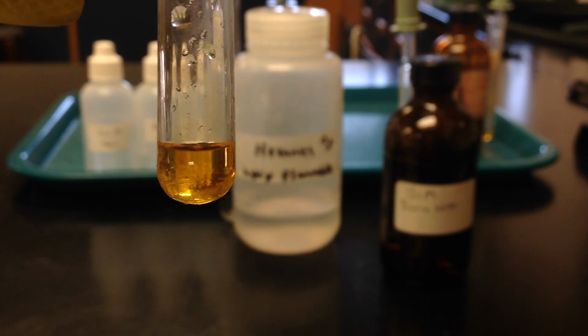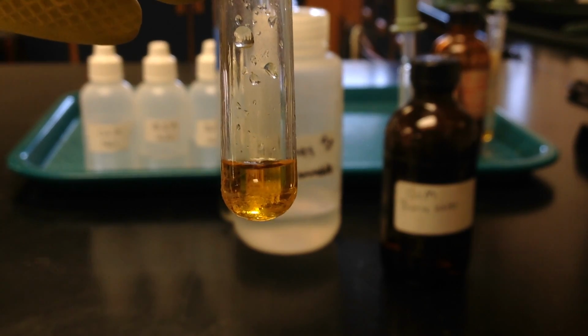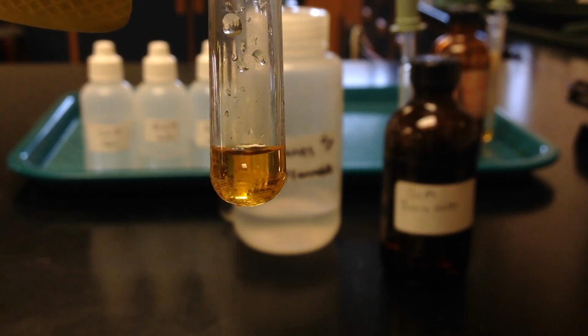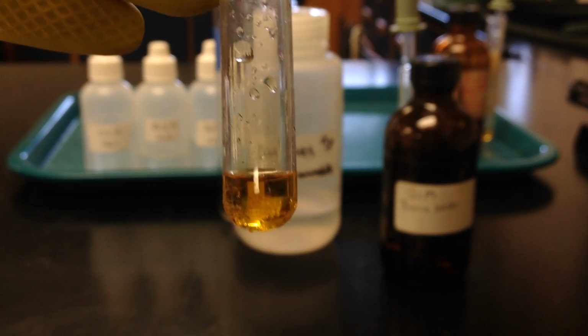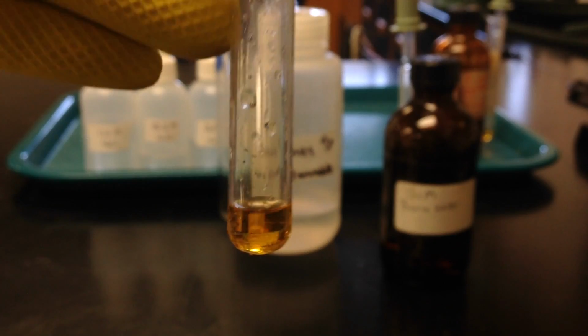And again, what you can't smell right now is that there are some strong bromine vapors in the air. So again, I did put the cap on the test tube. And as those bromine vapors leave the bromine water, once I add the hexanes, they're going to travel up into that hexane layer. And you also want to write down what color that hexane layer is.